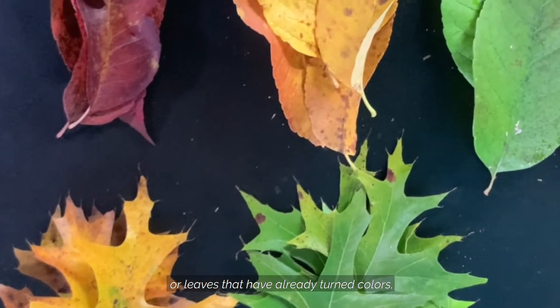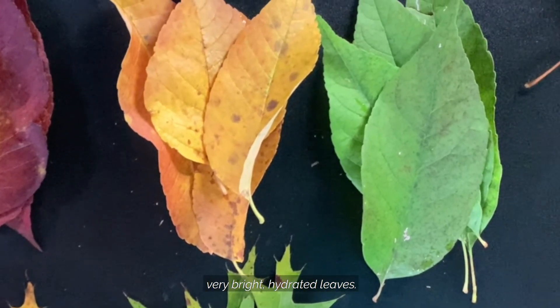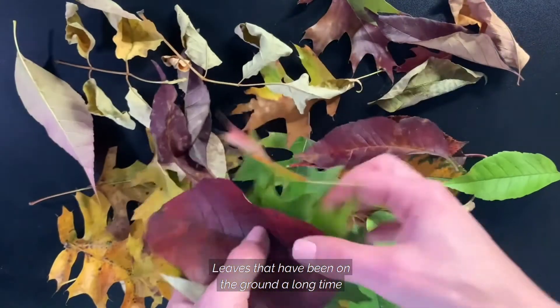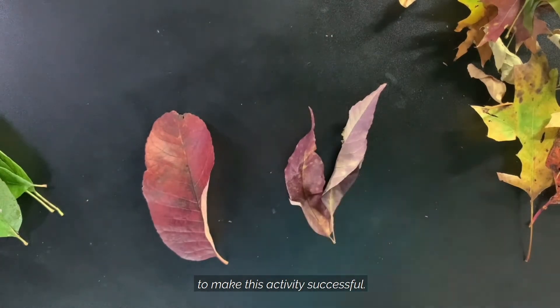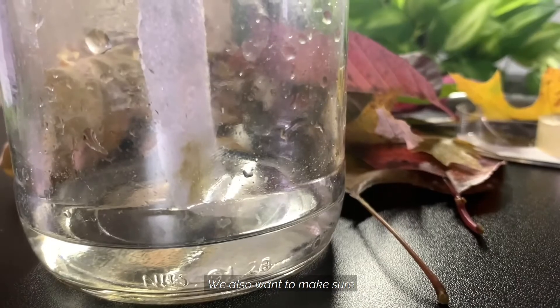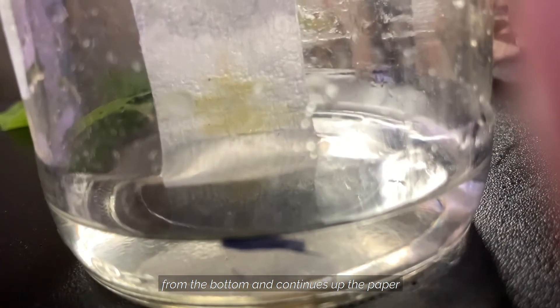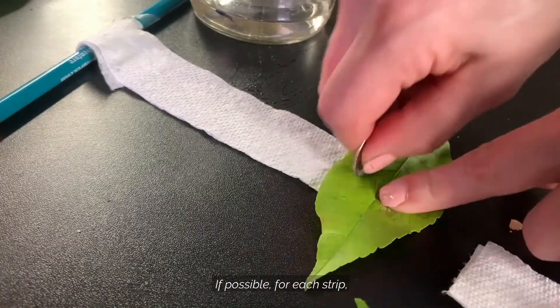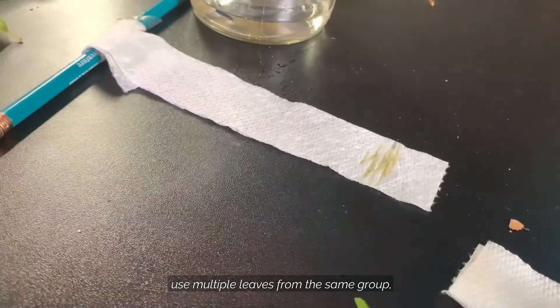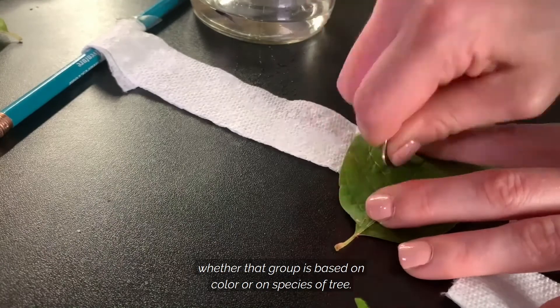Whether you're using green leaves or leaves that have already turned colors, we want to make sure that we use very bright, hydrated leaves. Leaves that have been on the ground a long time or are dehydrated will not provide enough pigment to make this activity successful. We also want to make sure that the paper does not touch the sides of the jars — it's really important that the rubbing alcohol starts from the bottom and continues up the paper from one direction. If possible, for each strip, use multiple leaves from the same group, whether that group is based on color or on species of tree.